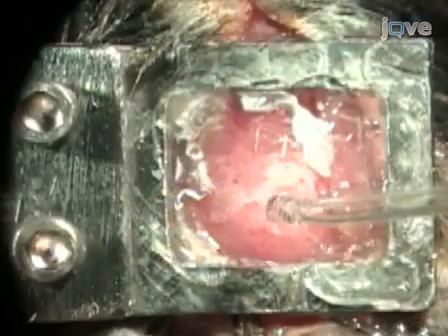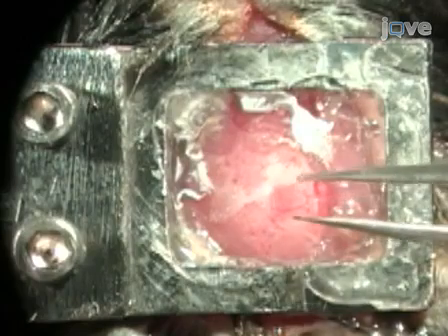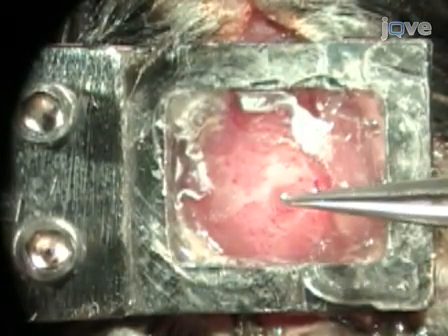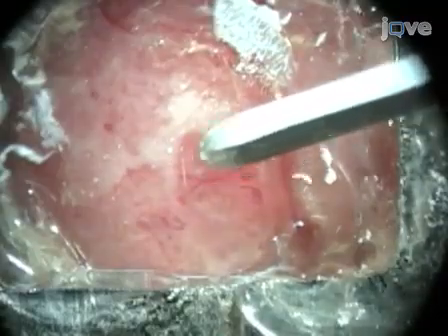cyanoacrylate glue onto the thin skull area and carefully lower a piece of cover glass onto it. Then press gently against the skull to squeeze out any excess glue, avoiding bubble formation between it and the cover glass, which may obstruct the view. Once dry, use a microblade to carefully remove any glue left on top of the cover glass.